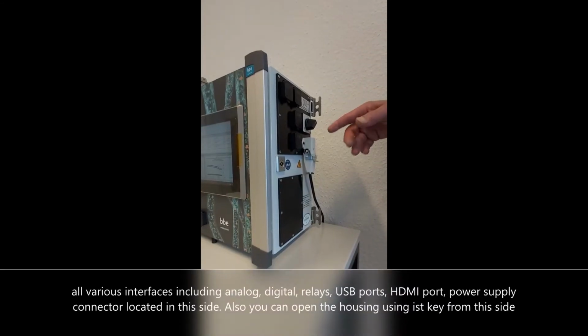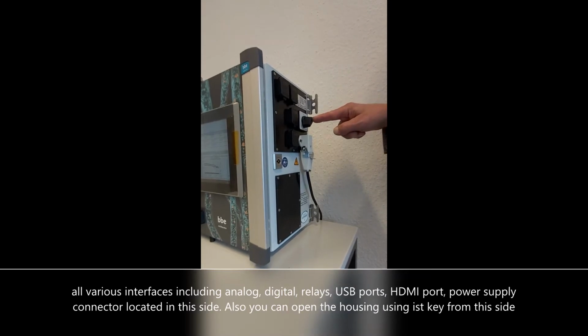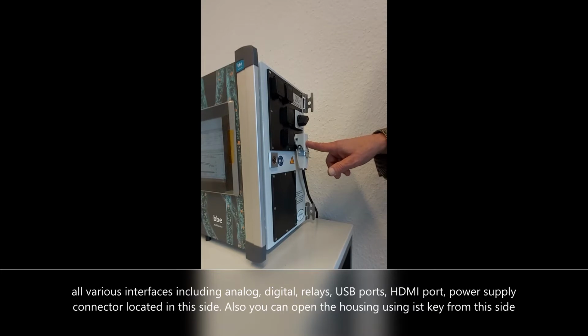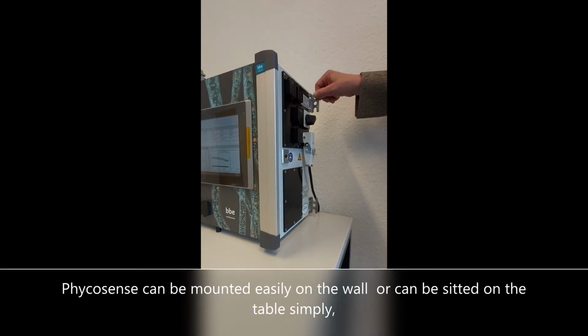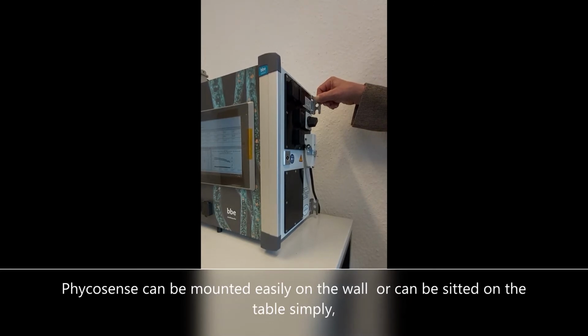On this side you see the main components, for example, the switch on/off, and we have here several ports and a connector to outer devices, for example for transport of the data to a control center. As you can see, the instrument is here on a desk, but of course it can also be mounted to the wall, for example inside of a measuring station. This instrument is a clear flow-through instrument which takes the information of the water quality all the time.